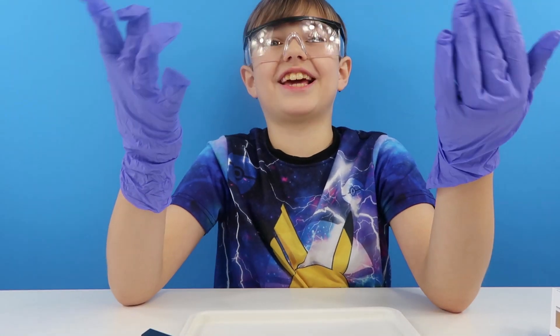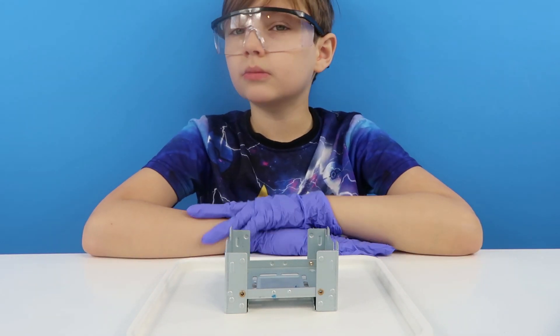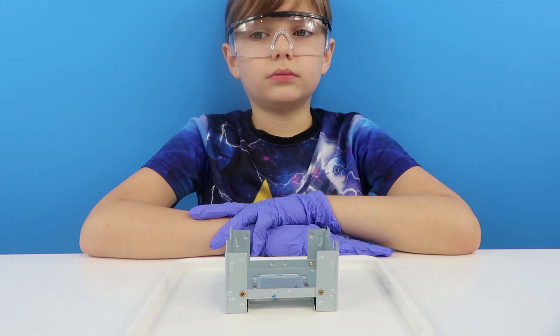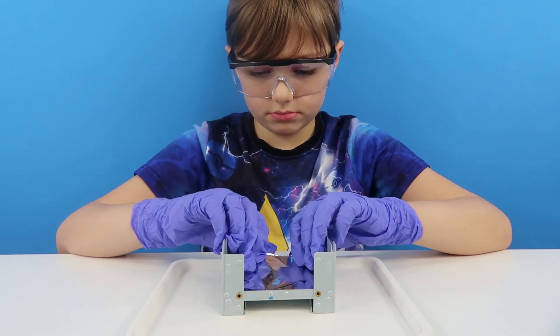Fits like a glove — get it? So we need a piece of foil. And it says just to lay the piece of foil on top. So we need this — I don't even know if I'm going to be able to say this.